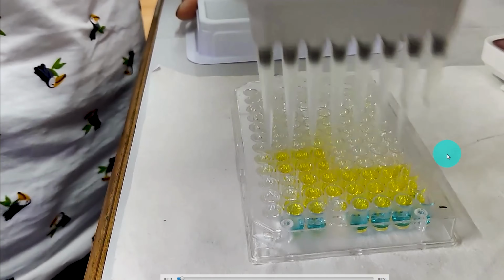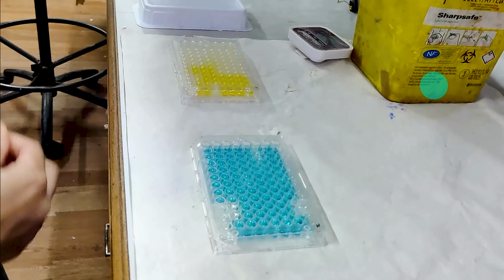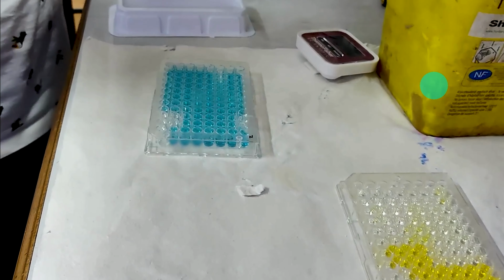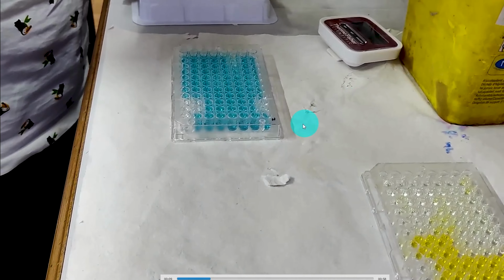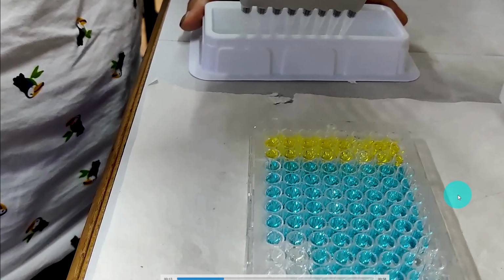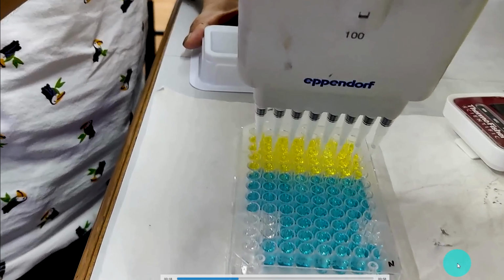Here I am showing an experiment in which we have the HRP TMB ELISA type, and we are adding the stop solution. This is not the same experiment that I am showing the data for the analysis purpose.